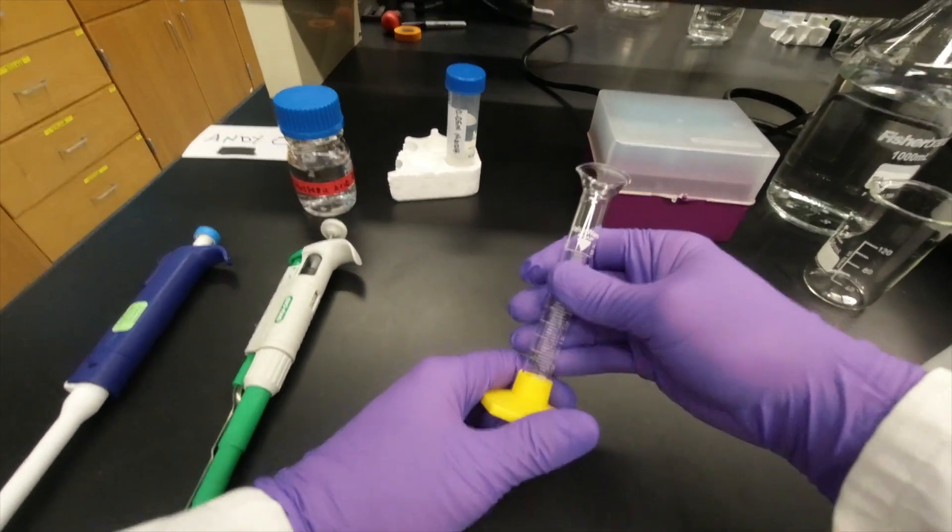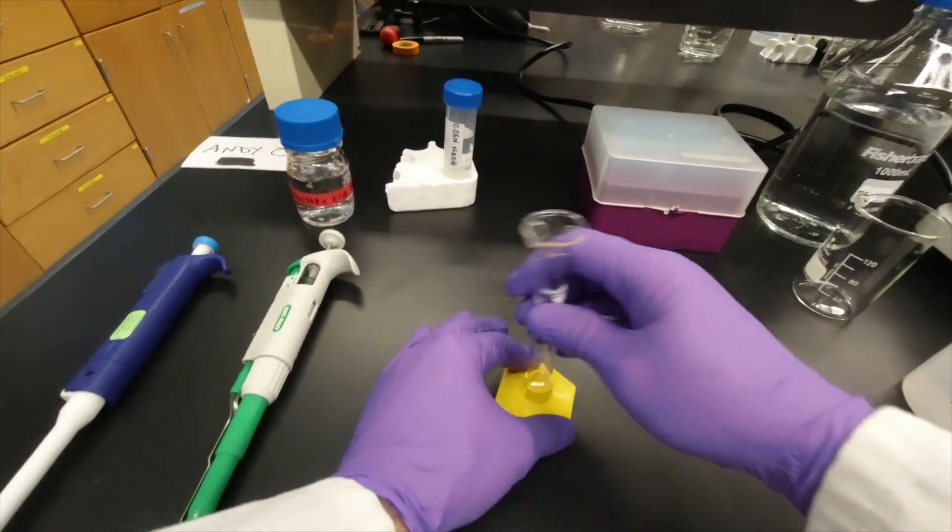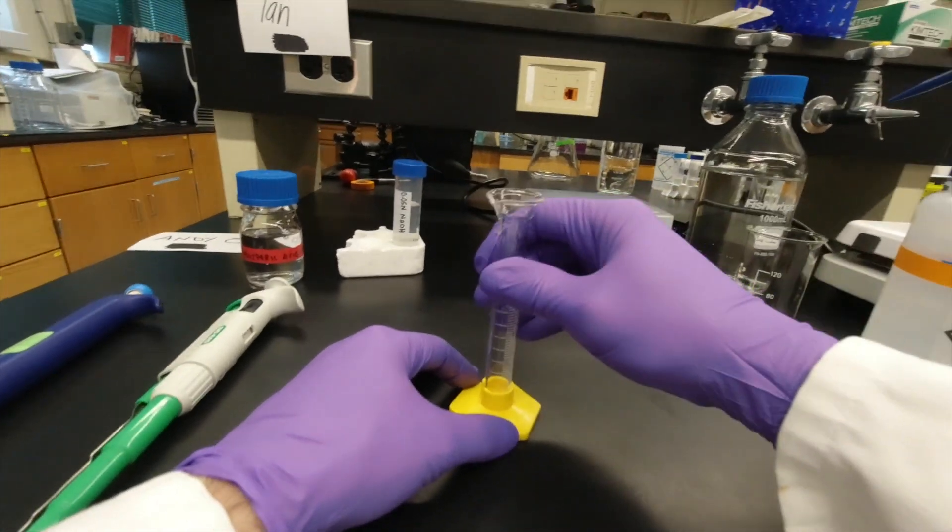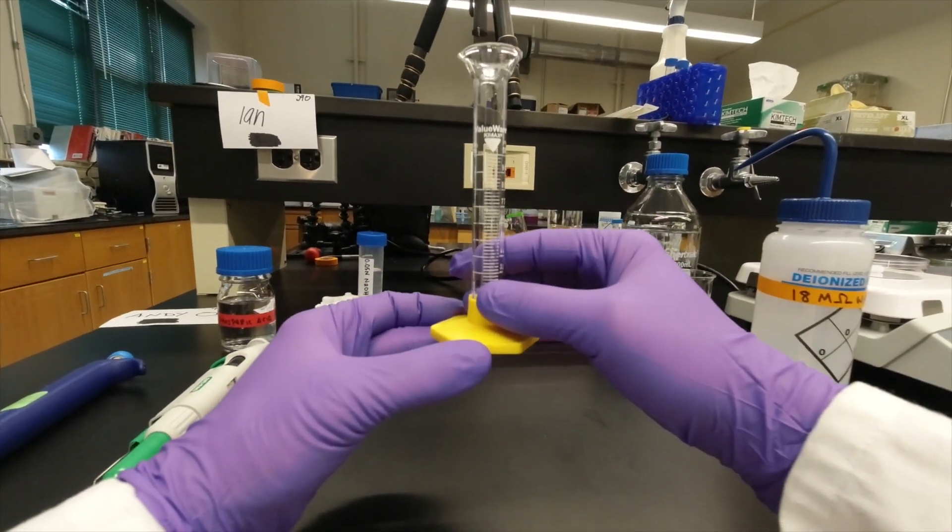Now a note about these graduated cylinders is that they come out, so if you don't put it in tight, then it can be wobbly, it can be off-center. So make sure you get it nice and tight, and when you're looking at it head-on, it should be nice and even.